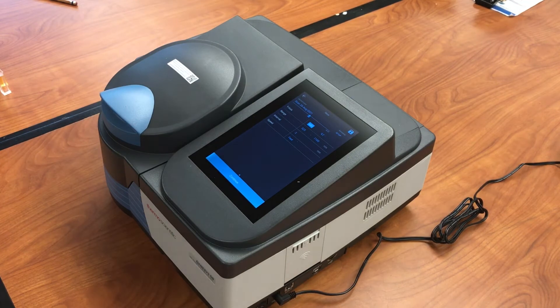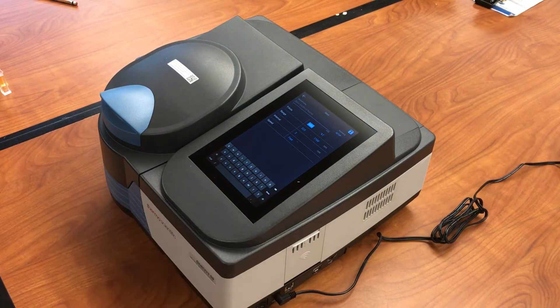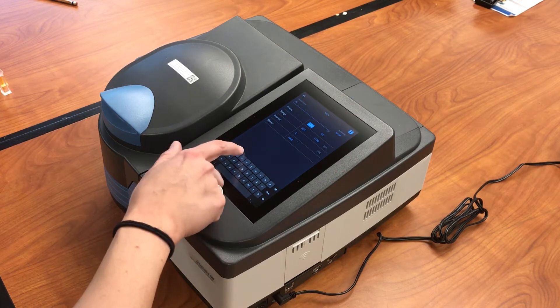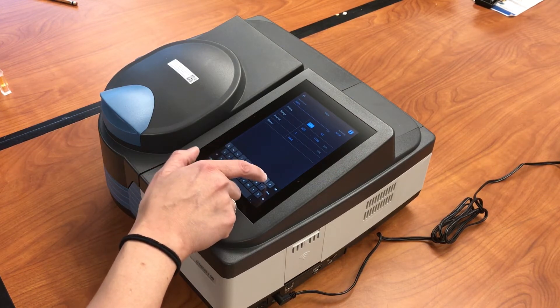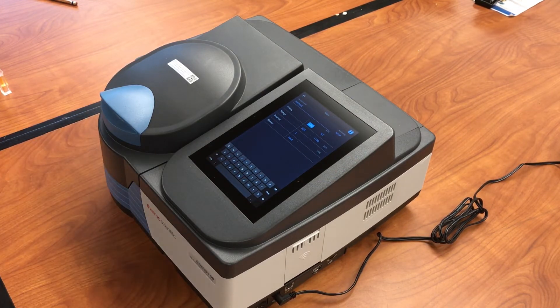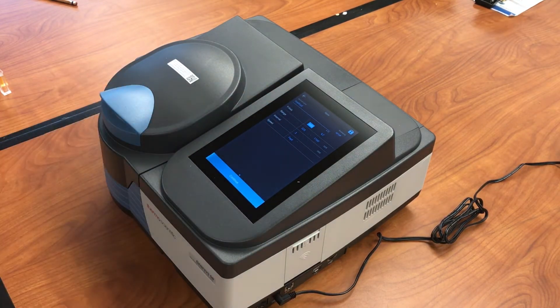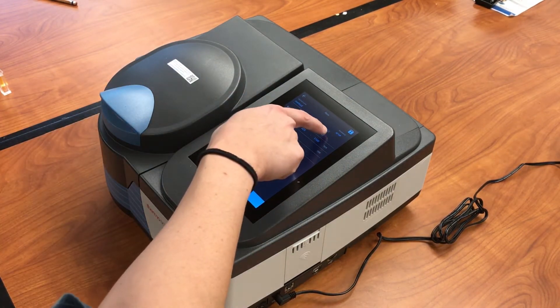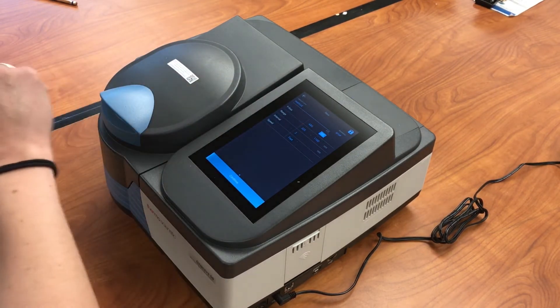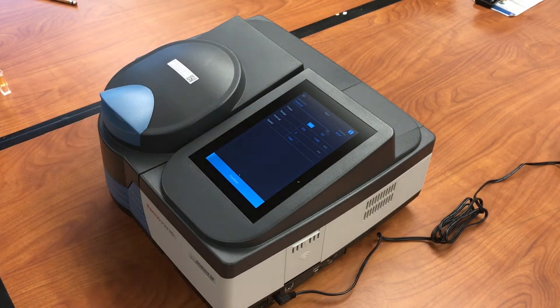At the top, you can actually give this method a name. You can select whether you're going to look at absorbance or percent transmittance. We're going to stick with absorbance.